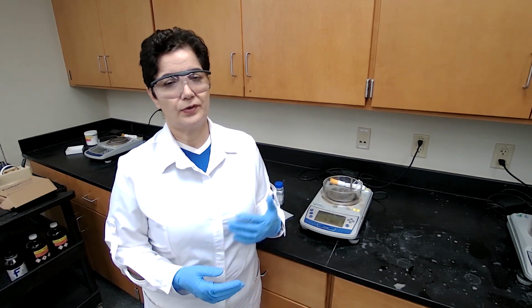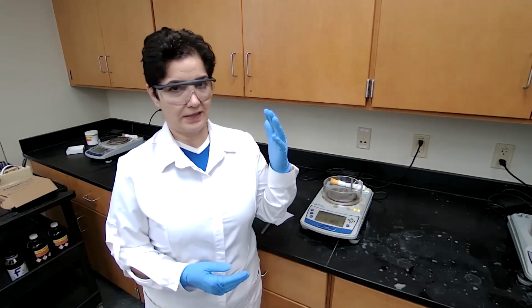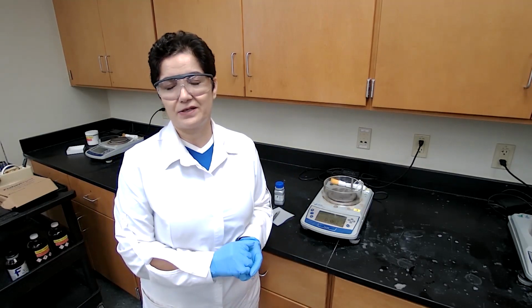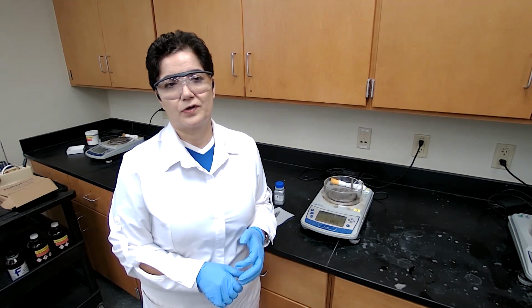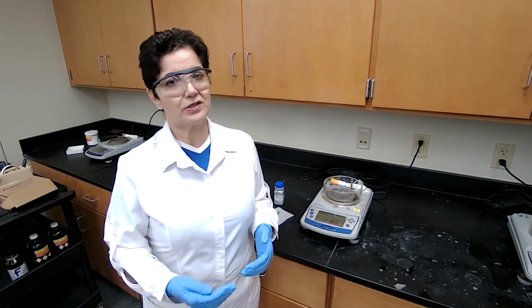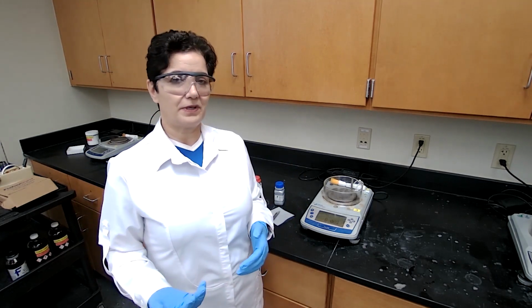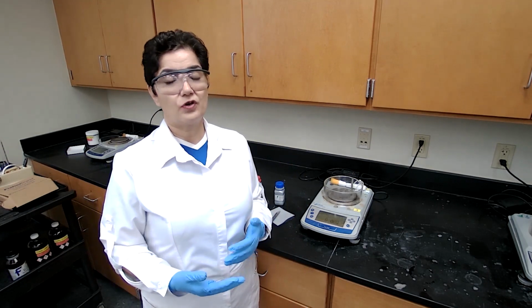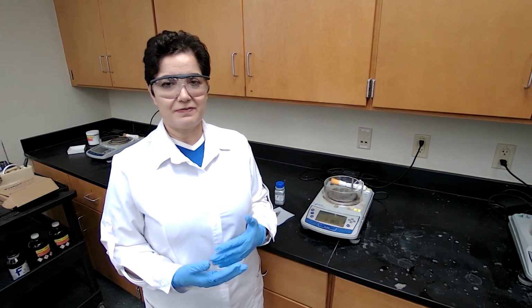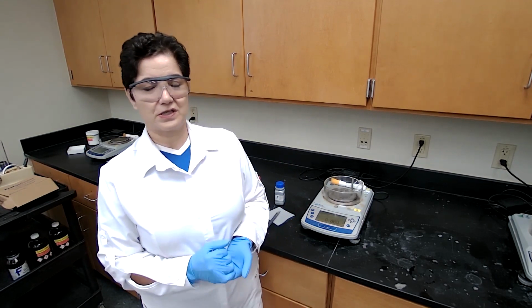So our reactant is a ketone, which has a specific peak at 1700 in the IR spectrum. After reduction, that peak is going to disappear in the product, and you will see a peak at 3300. For more details about the chemical reactions and the purpose, please make sure to watch the pre-lab discussions for this experiment.